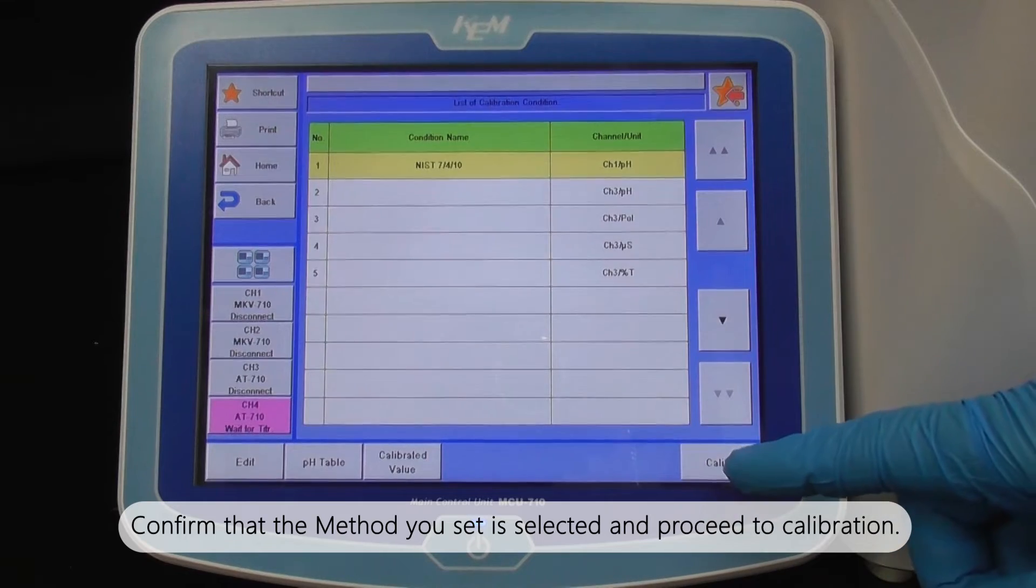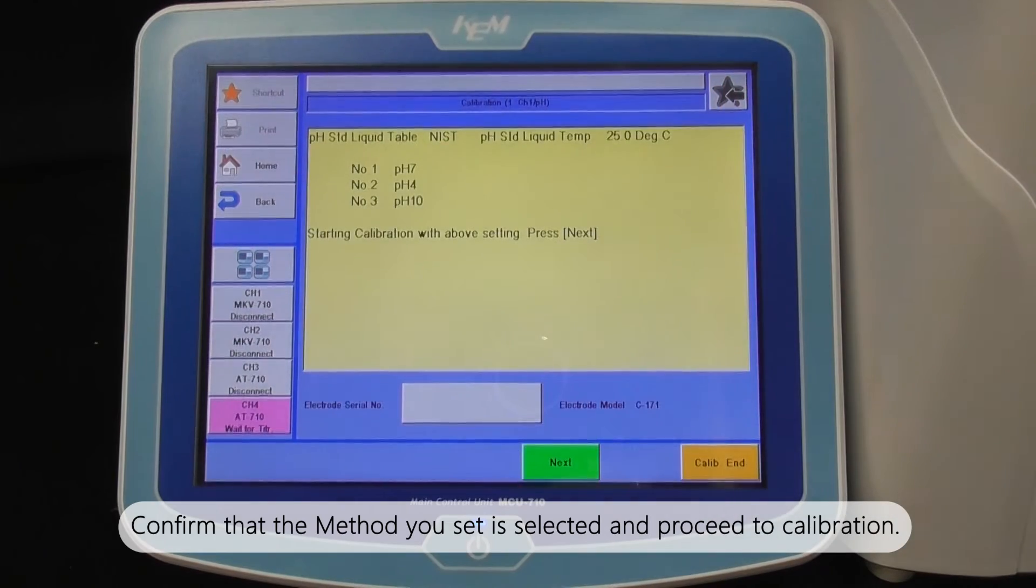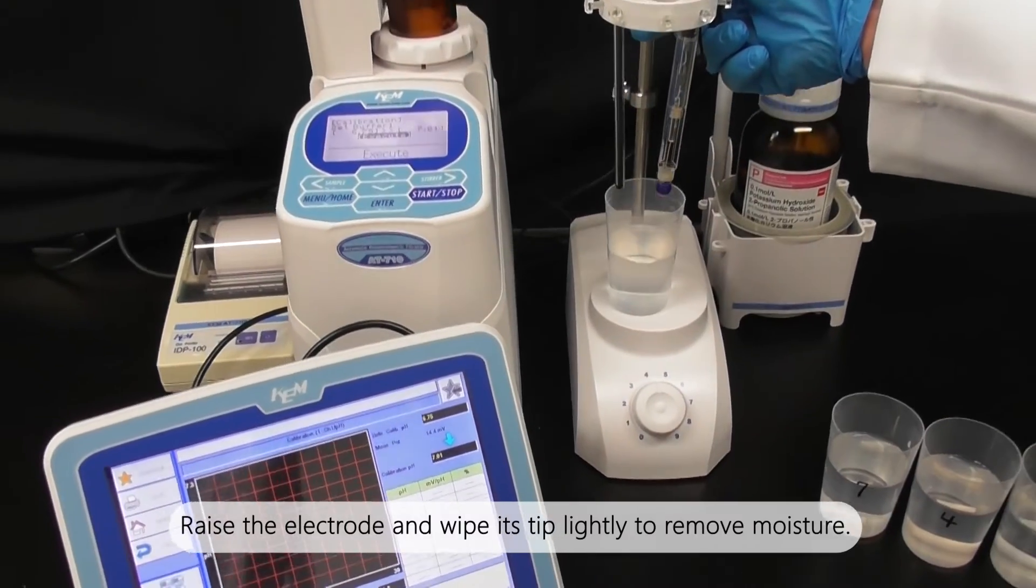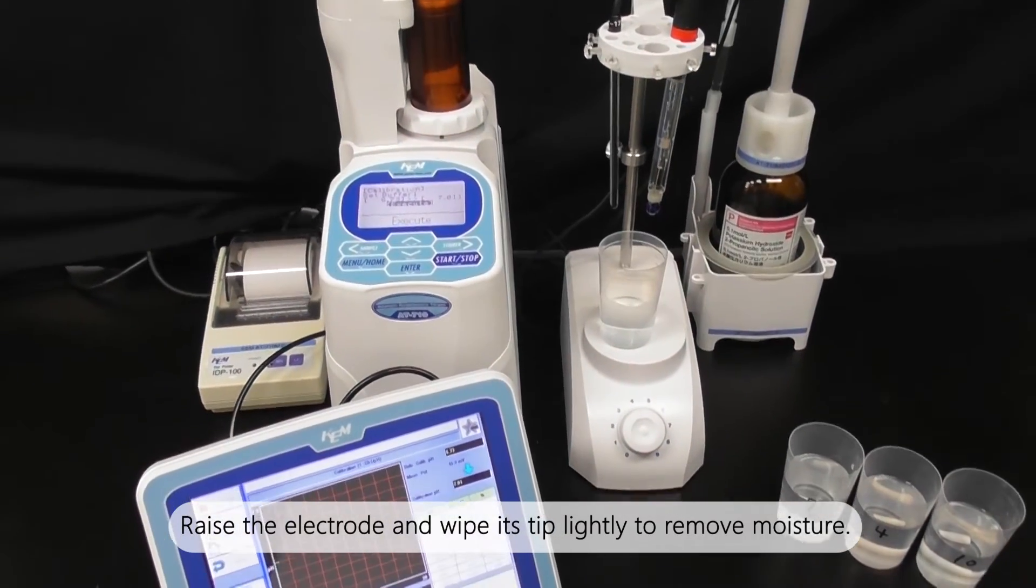Confirm that the method you set is selected and proceed to calibration. Check the calibration settings and then press next.